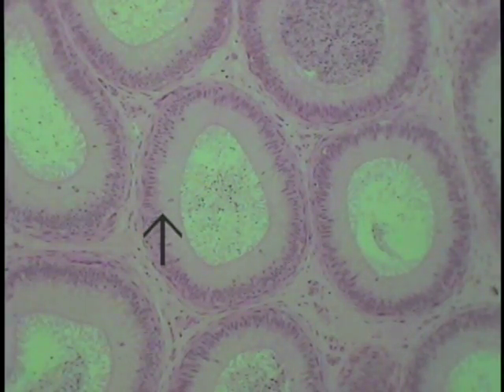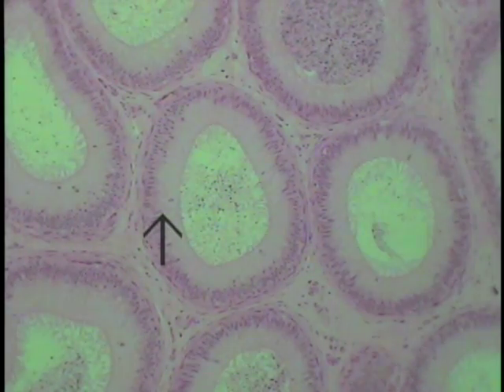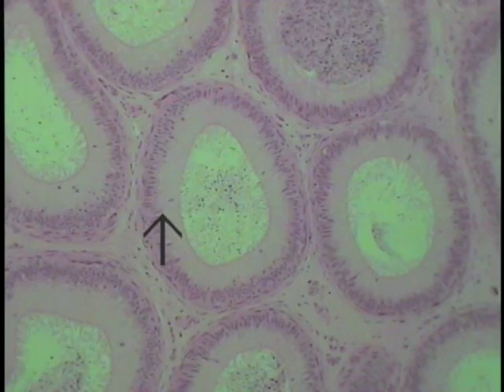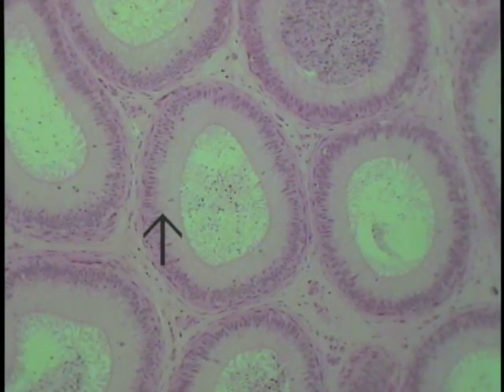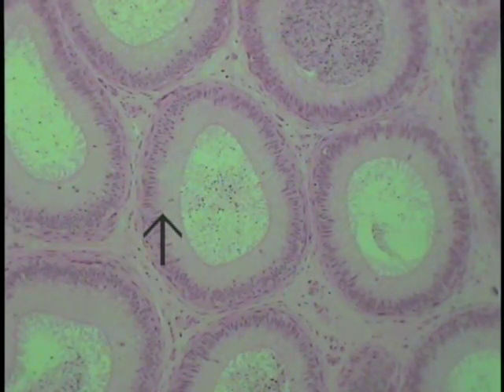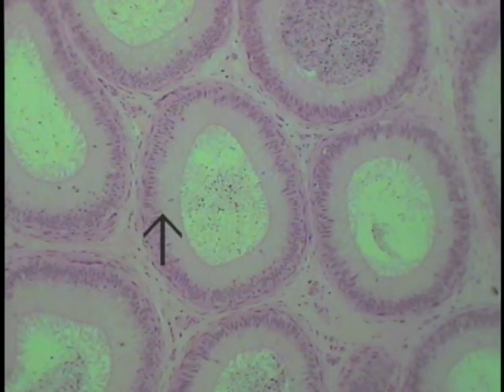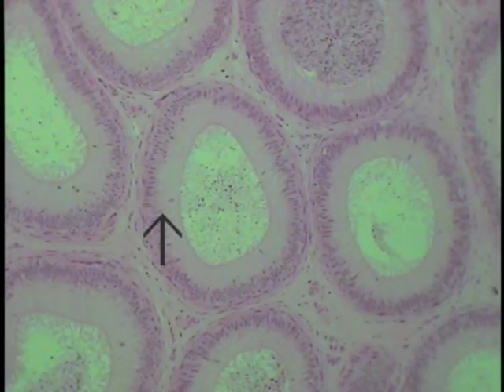Unfortunately, sections through the mediastinal area are missing. What will not be shown are the tubuli recti (straight tubules lacking spermatogenic cells), the rete testis within the mediastinal area, and the efferent ductules — so those three segments of the excurrent duct system will be absent. The first segment of the excurrent ductal system for which a specimen is available is the epididymis.